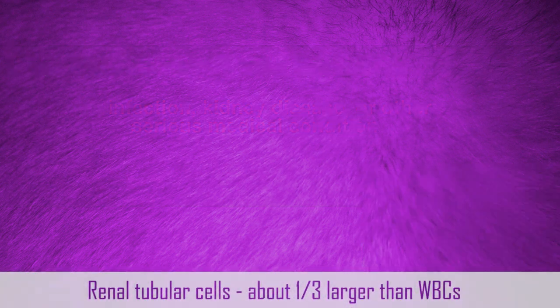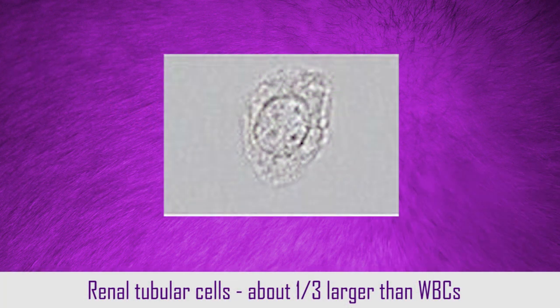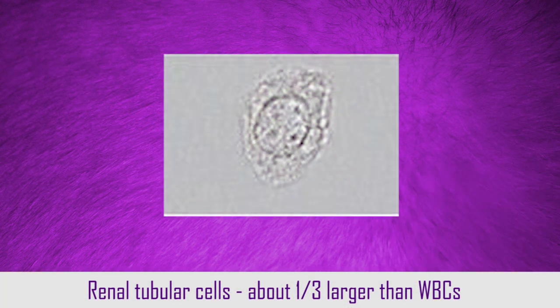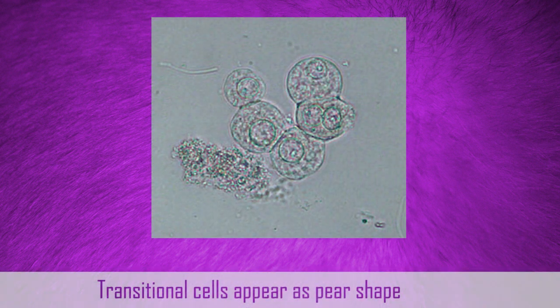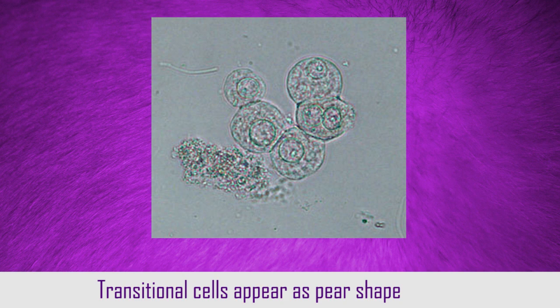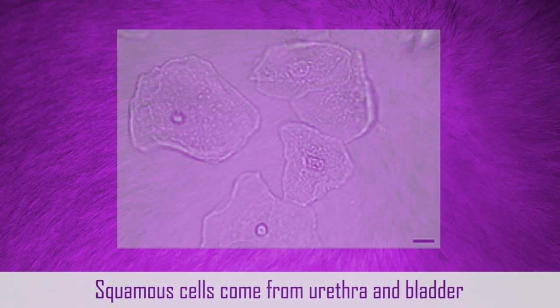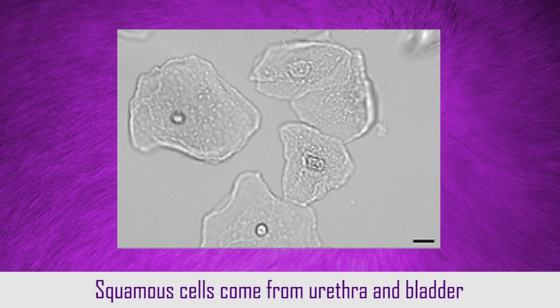Renal tubular cells are about one third larger than white blood cells. Transitional cells appear pear-shaped and arise from the renal pelvis or lower urinary tract. Squamous cells come from the urethra and bladder.